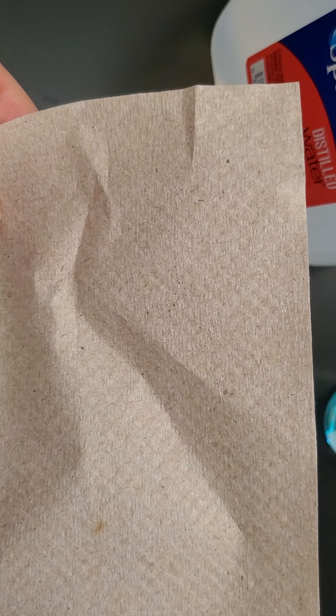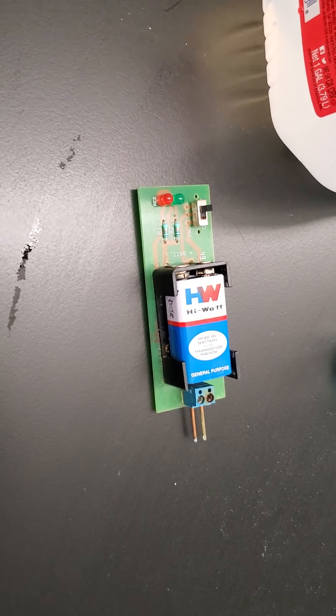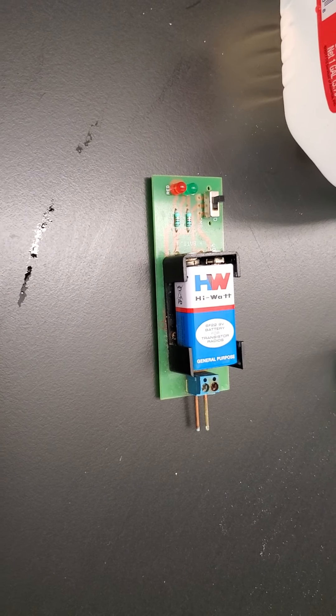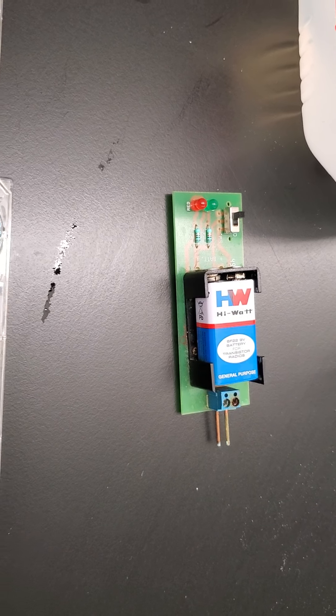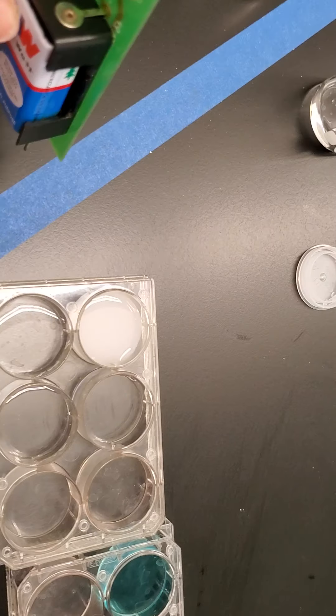What I'm going to do each time I use it is take my paper towel, dip it in some water, and make sure I clean it off every time because I don't want to contaminate with my previous sample and get a false reading. Okay, be back.